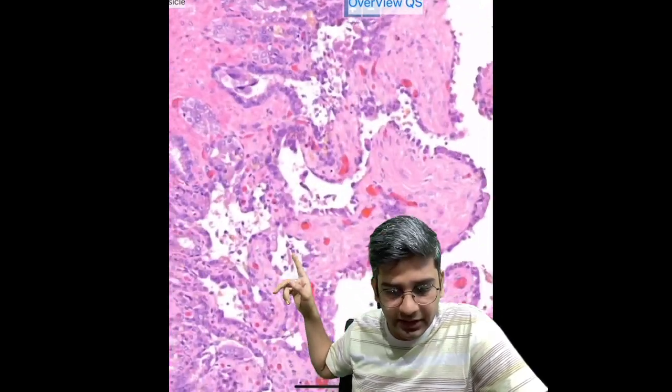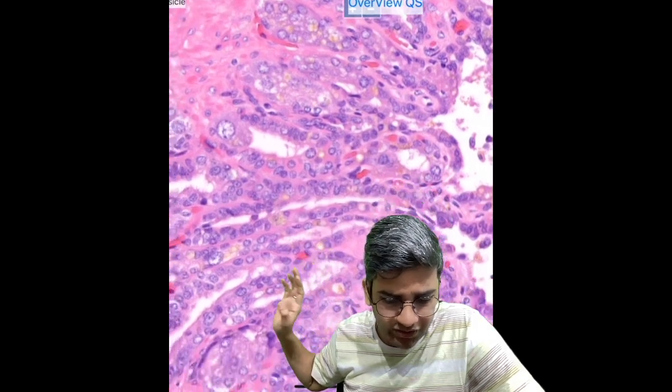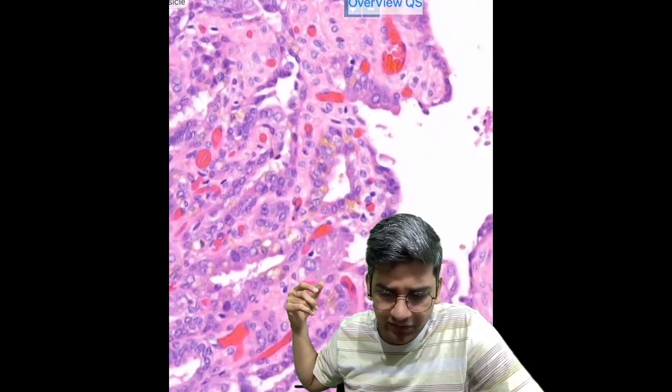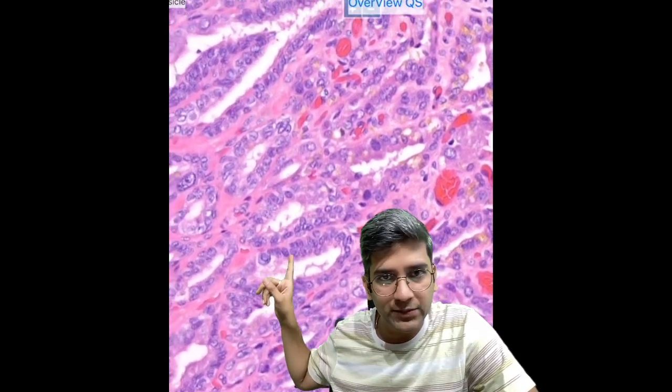This is the overlying epithelium. One characteristic finding you can see here is the amount of lipofuscin. It's pretty evident. Whatever you can see easily here is the type 1 lipofuscin, which is coarse and golden brown in color. The pale ones are a bit difficult to identify. Maybe if you see a real slide and spend some more time, you can easily identify them as well, right?